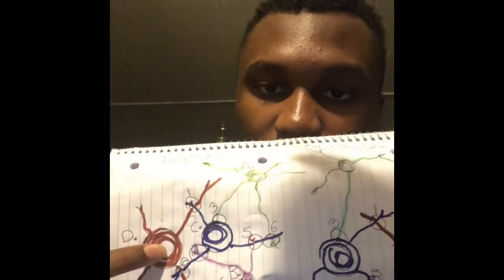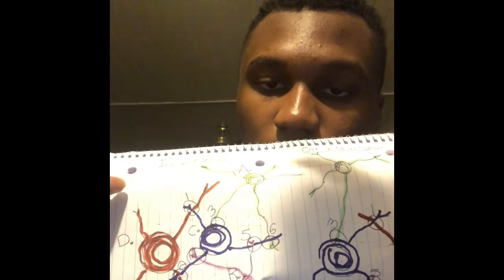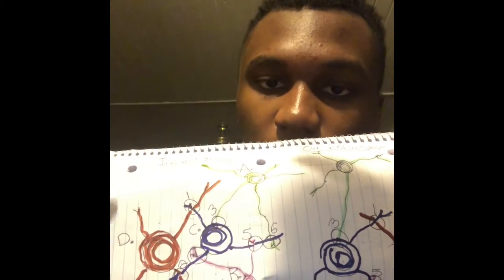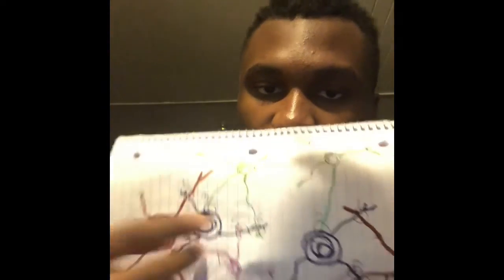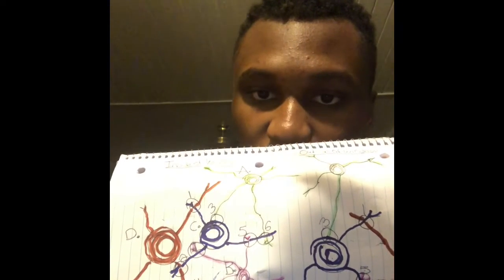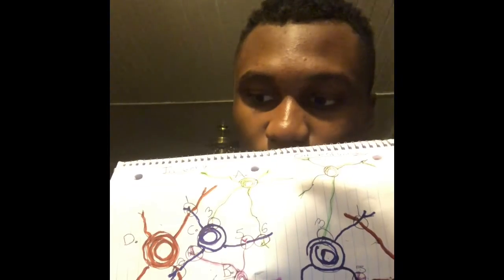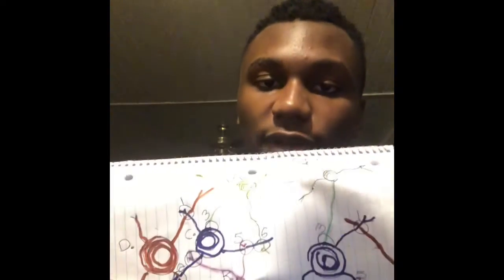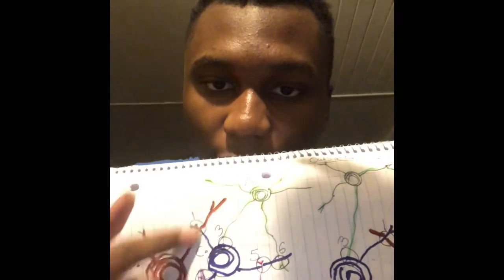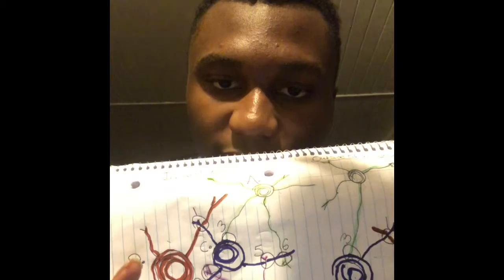Now, as you can see, I think the order is D came first, then C, then B, then lastly A. Same thing over here. D is the first projectile I had, and in the list that I just said, that's how it goes down. Now the proof I have for this is, if you look, D is extending outward. It's not trying to hit anybody. It keeps cracking till it runs out of energy.